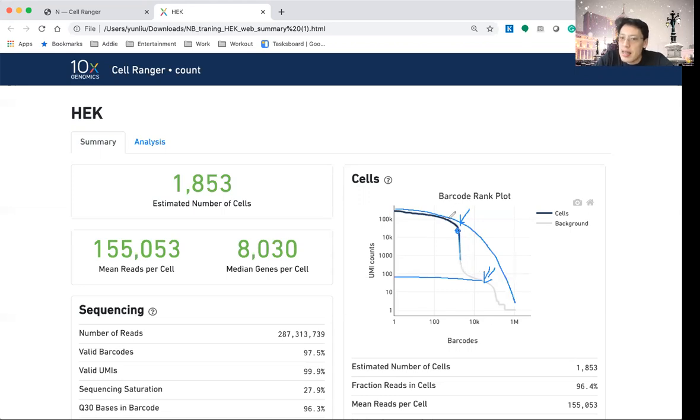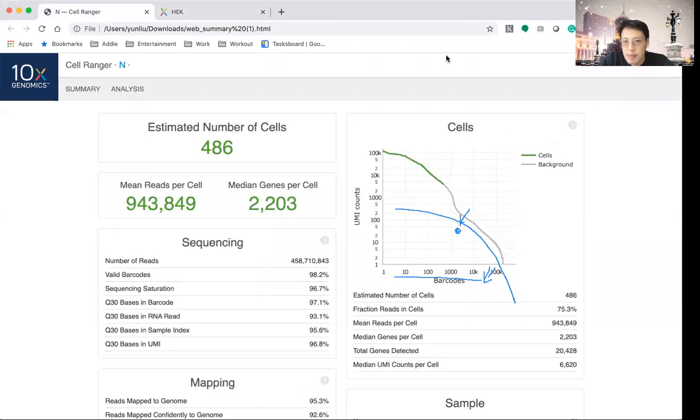So in this case, we will see this sudden drop here, and then there is a gradual small ladder here, and then a further drop off. So let me show you one other figure that I give you as a very bad example, which is in this case. So you can see that what I'm seeing here is really a gradual drop, and I have not observed a sudden drop at a certain point. And this is an indication that the experiment is not giving me very good results.